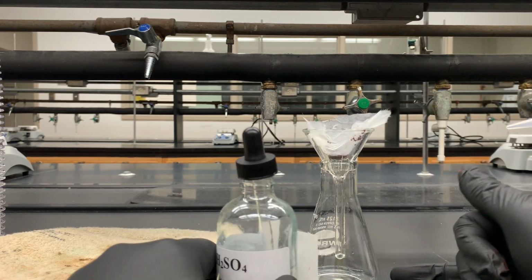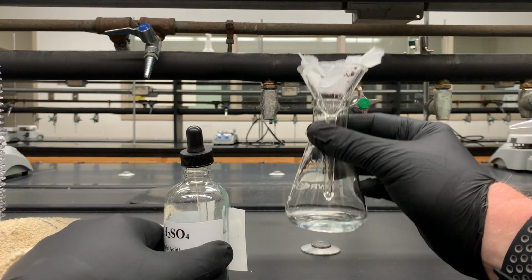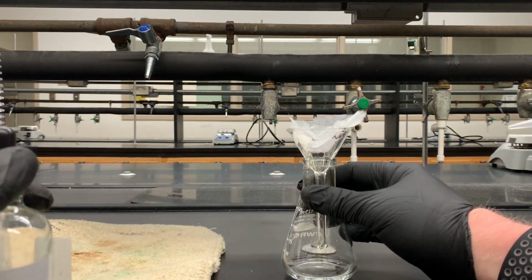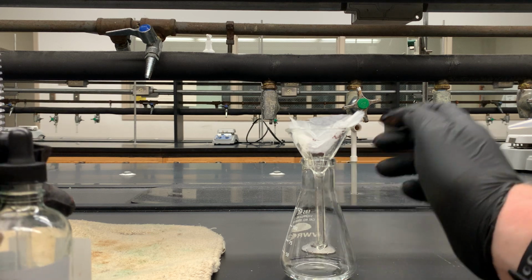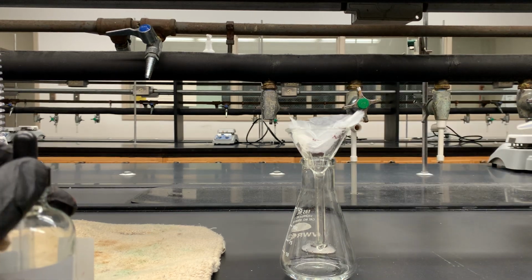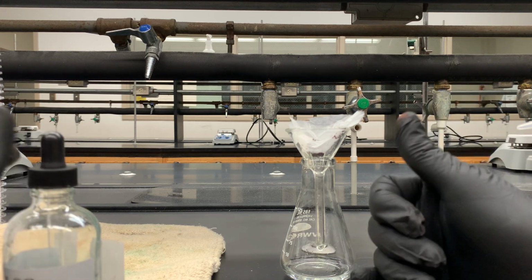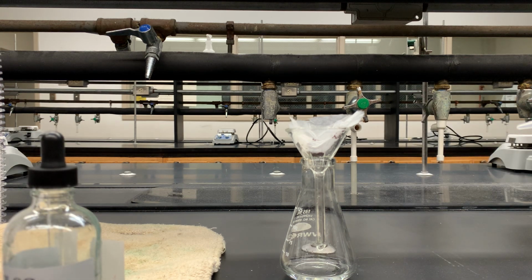So the solution down at the bottom is just going to be the zinc ions and no copper ions, and ideally no solid copper. You're going to take that coffee filter and that solid copper that remains, put it on your watch glass and put your watch glass in the oven. Let that incubate for 10 minutes and then determine the mass of that mixture.